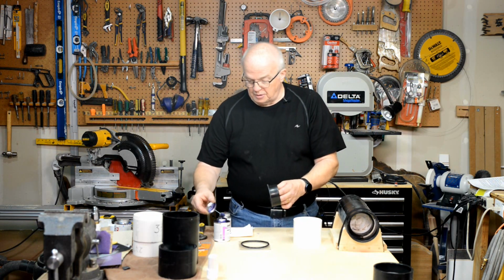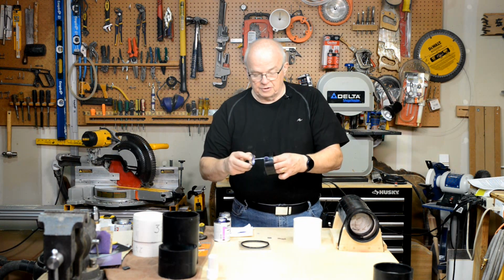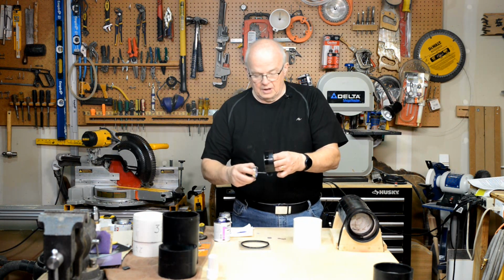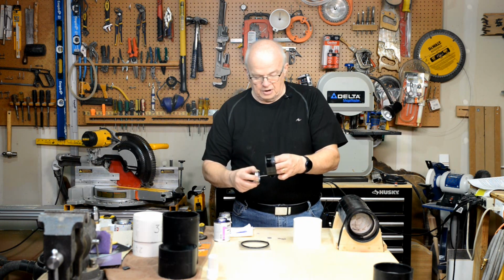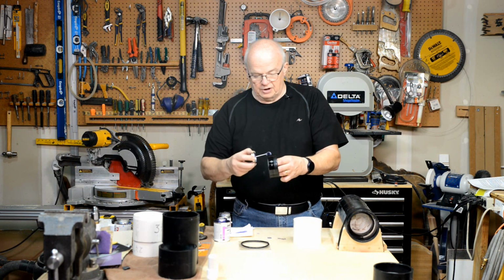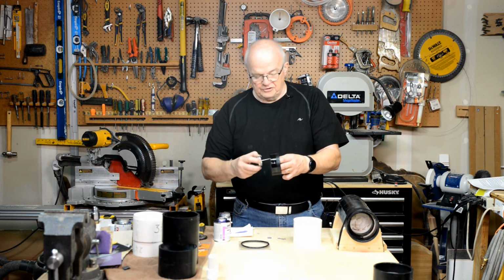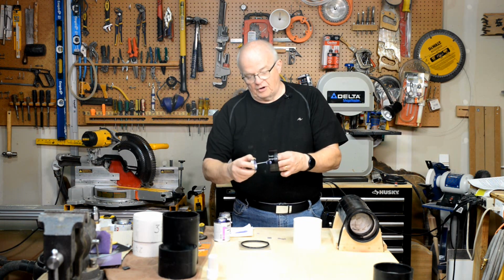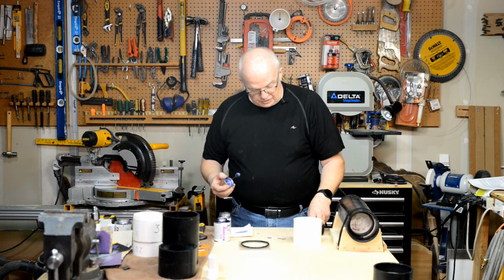So I'll take the primer, and oh, see, I dripped a little bit there. And I'm going to go around several times. I'm not going to get close to that outside edge. And you'll actually feel the primer start to dissolve that ABS plastic. Okay, and that's what you want.